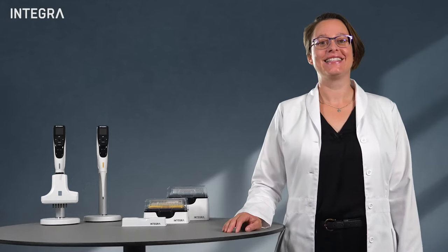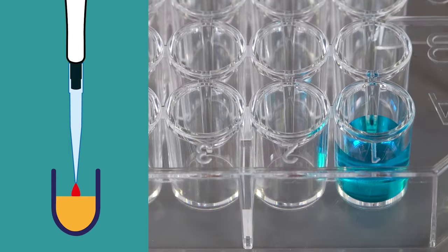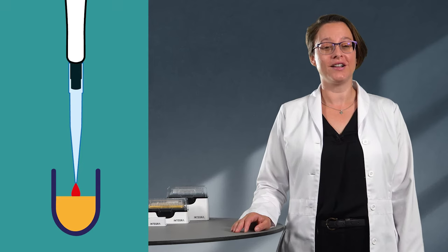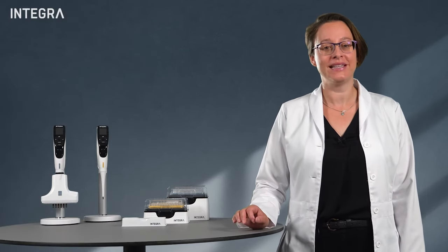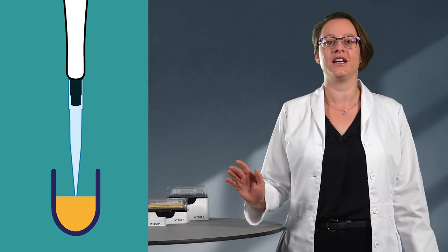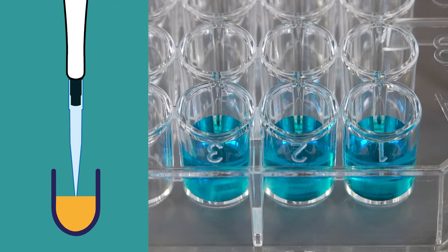The surface of the dispensed liquid can be touched immediately after dispensing. This can remove the drop. There's also another way. If the tip opening is completely submerged after dispensing, there is usually no need for a touch-off, since the drop will remain in the dispensed liquid once the tip is removed.